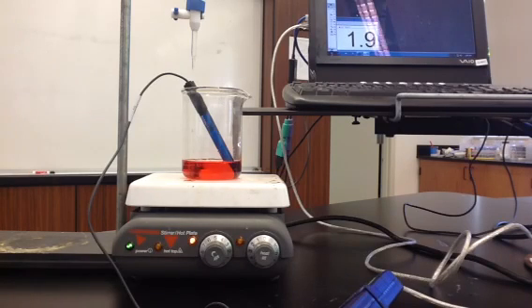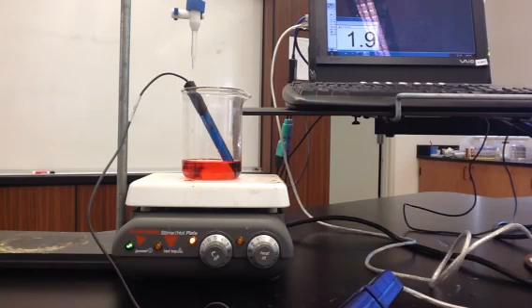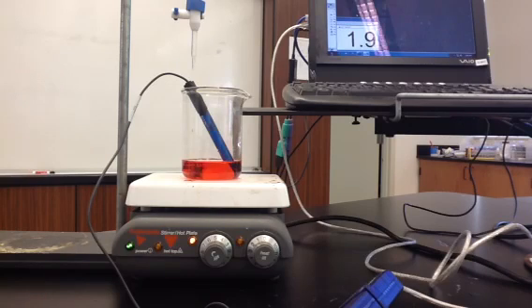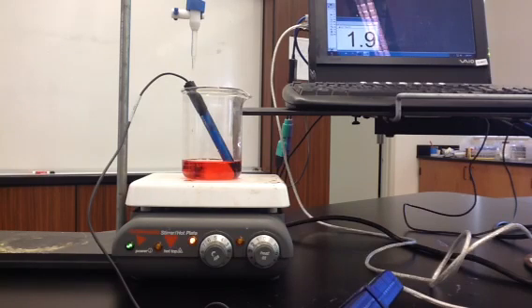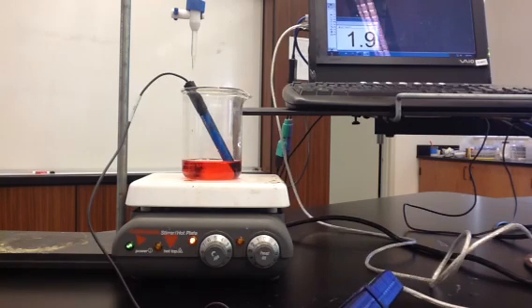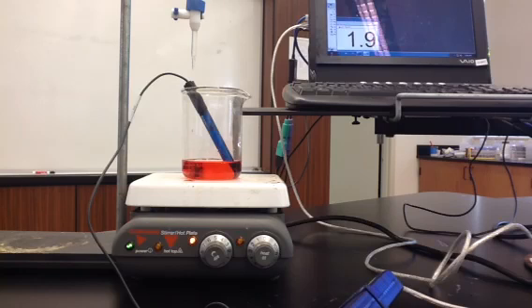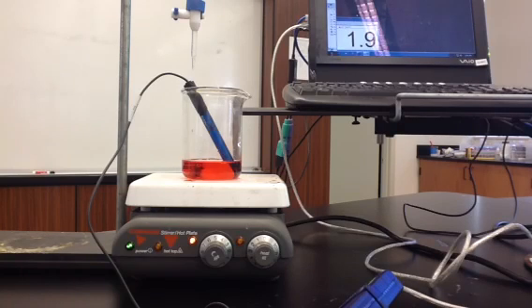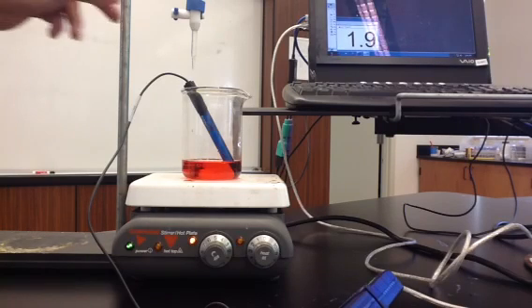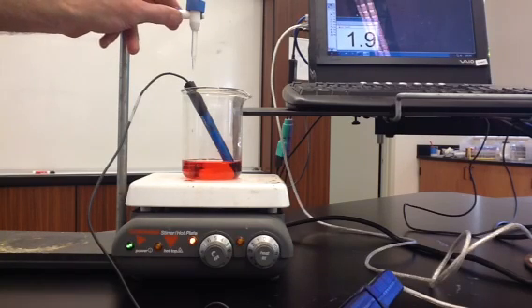Up above this, in the burette, I have sodium hydroxide, and I have 50 milliliters of it. I'm going to slowly add the sodium hydroxide and we'll see how that affects the pH. I'm going to add it one milliliter at a time.